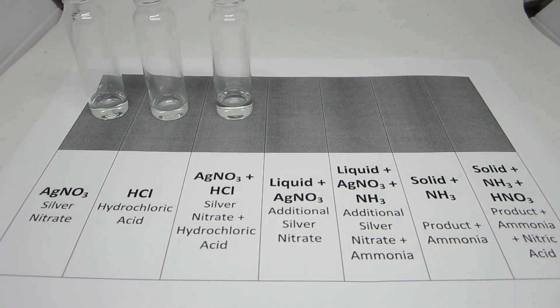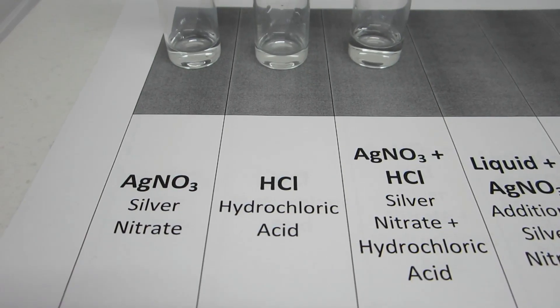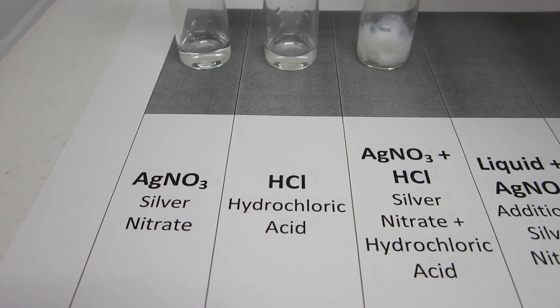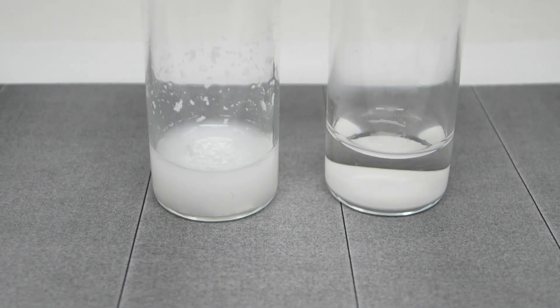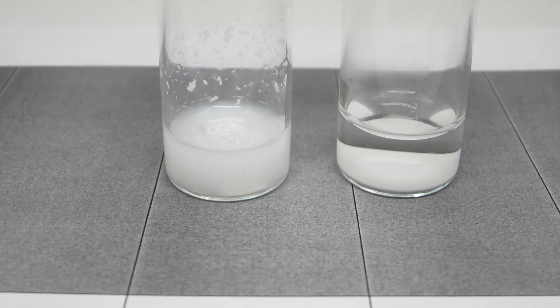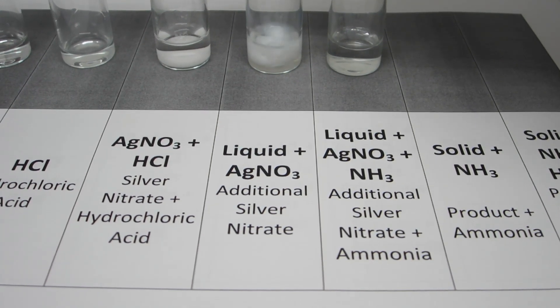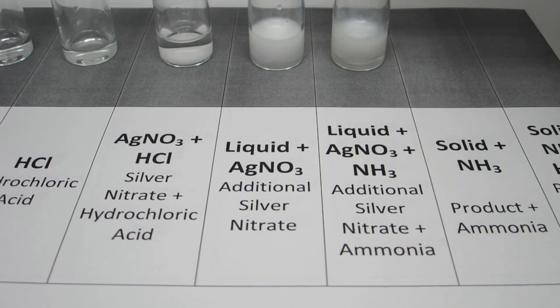The sixth and final equilibrium reaction is the equilibrium of silver chloride. Silver nitrate and hydrochloric acid are both clear and colorless solutions. On mixing, an intense white precipitate is formed with the formation of silver chloride. Over time, this reaction mixture settles to separate the solid and liquid components. Addition of silver nitrate to the liquid component causes continued formation of precipitate, indicating that the silver ion was the limiting reactant in the initial reaction.